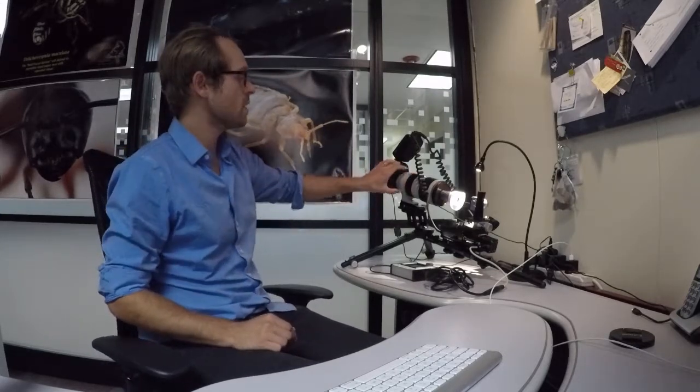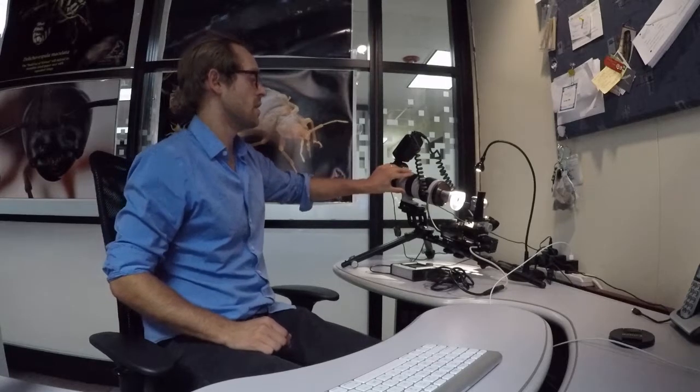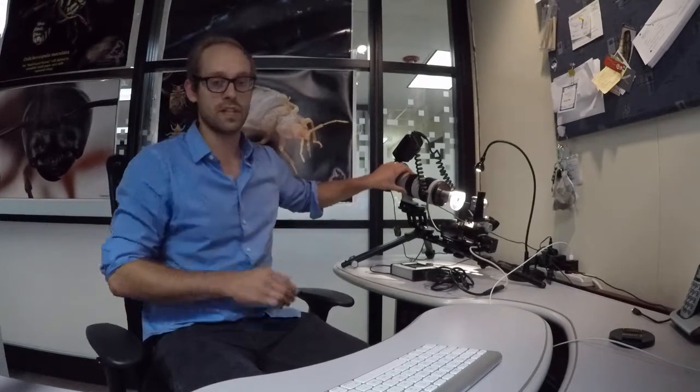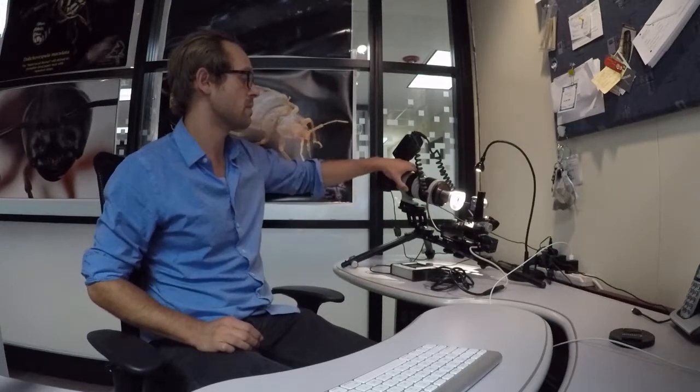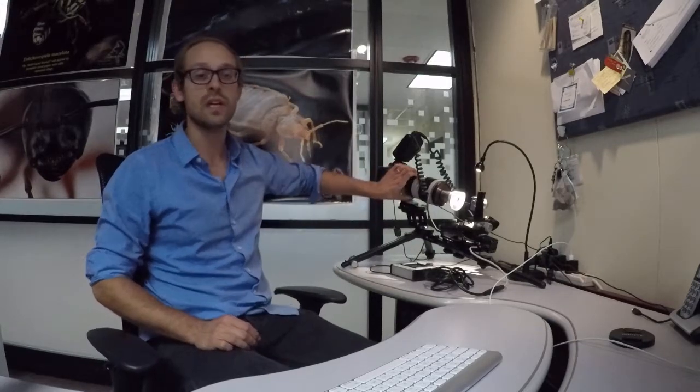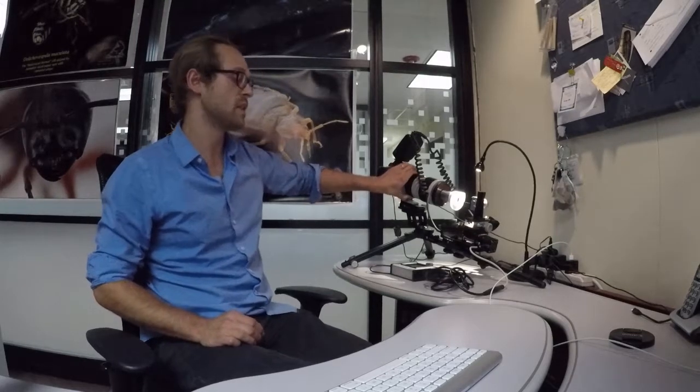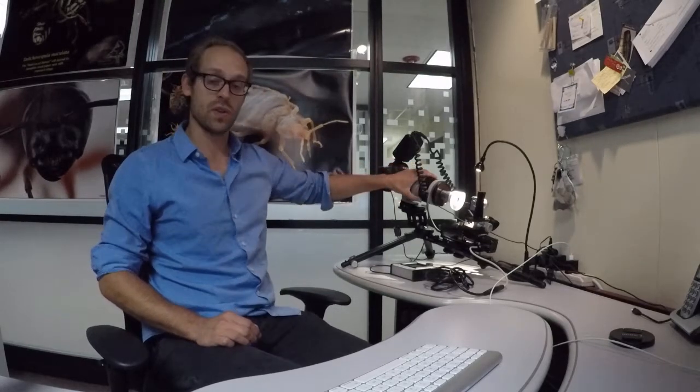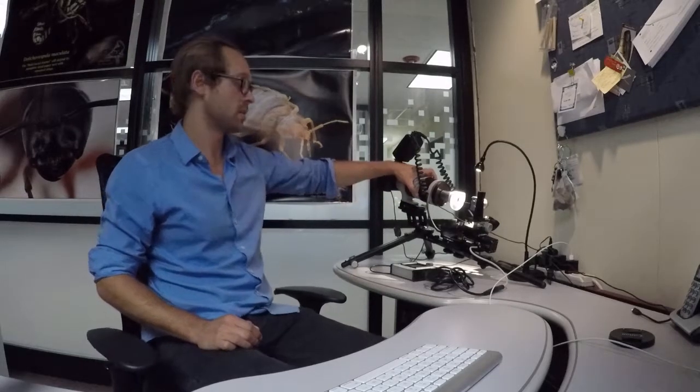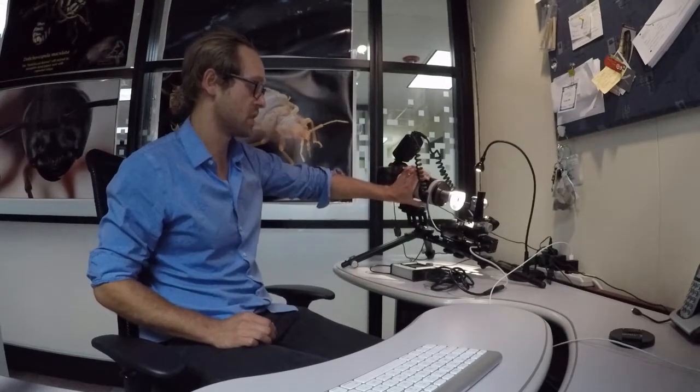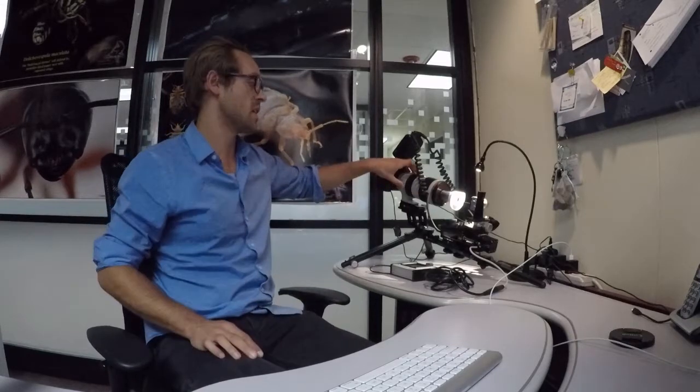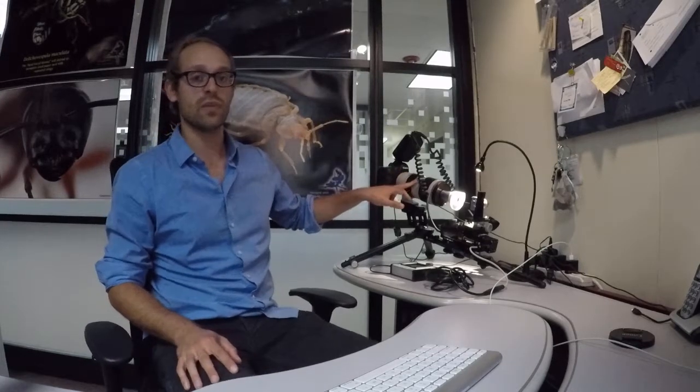The next thing you want to do is set the millimeter range to what the objectives would require, and in this case it's 200 millimeters. So from 70 to 200 millimeters you want to be positioned directly in the 200 millimeter range. And you want to also adjust the camera so that you're shooting at your infinity range. So you want to just turn this nozzle here until you have the little infinity sign lined up with your tick mark on the top of the lens. So to say it very straightforward, easily those are the settings you want to have preset on this lens before you start to shoot.